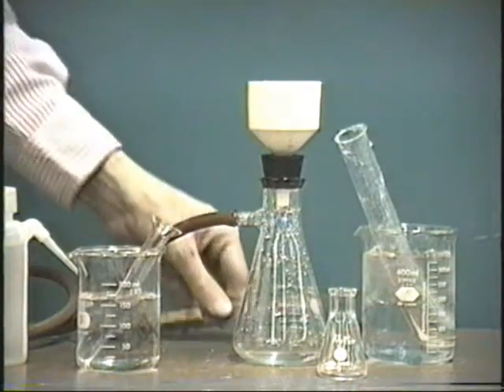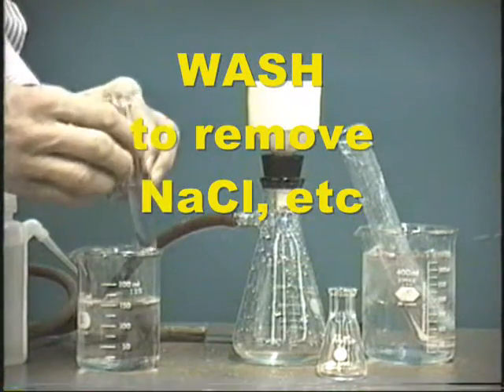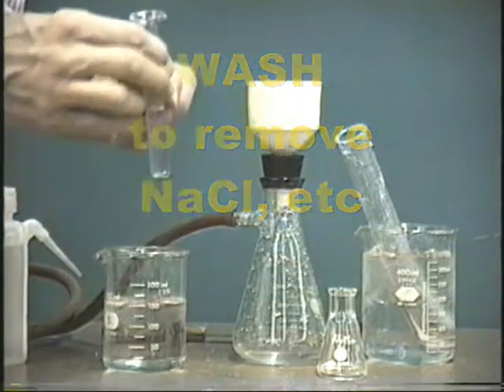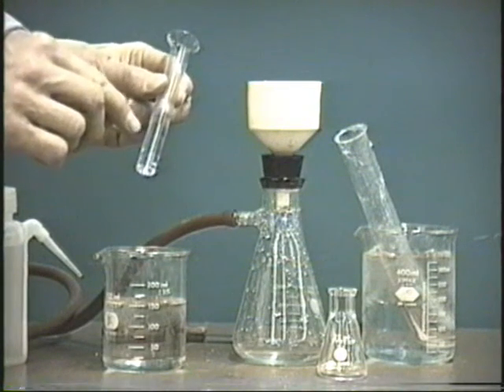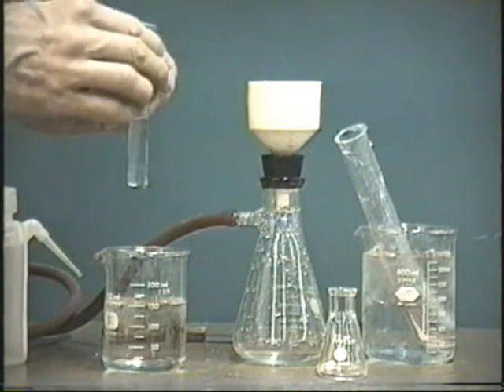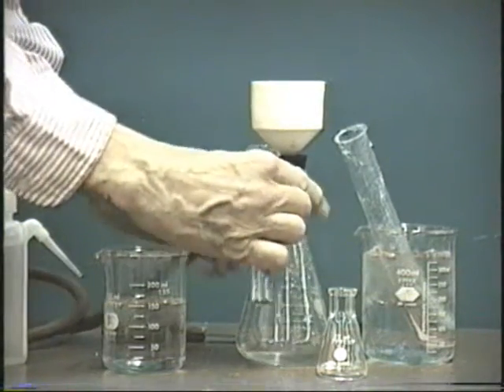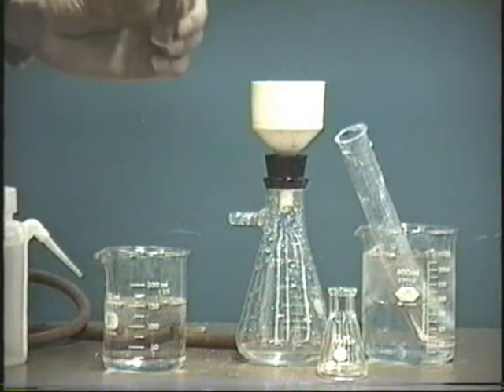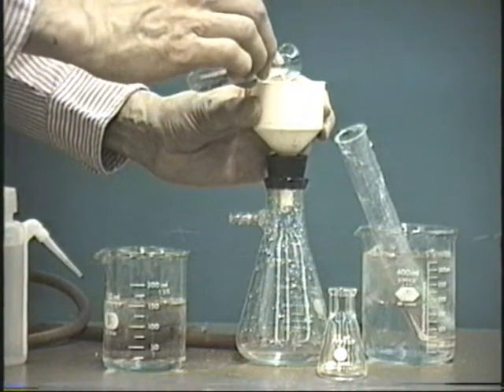And now we can start the washing procedure. We will wash it with water, and we're using only a little bit, about 6 milliliters, and we'll wash it twice. Now when you wash it, disconnect the suction, put in about half of this water, and spread it out over the sodium bicarbonate.